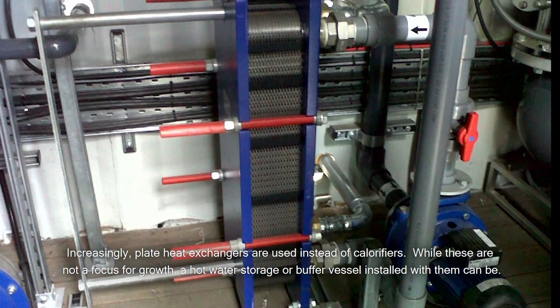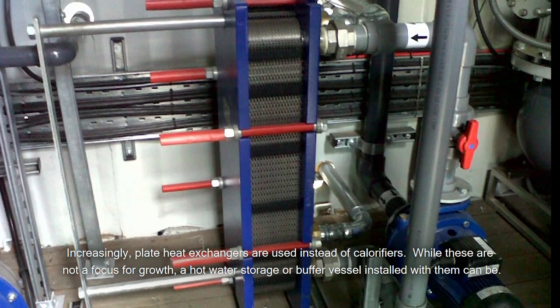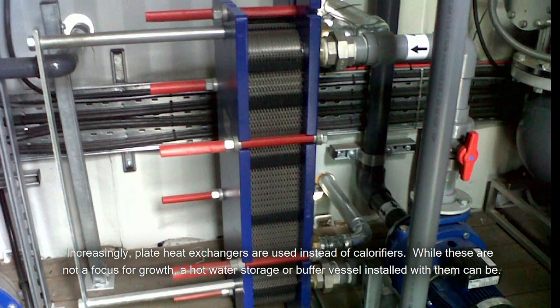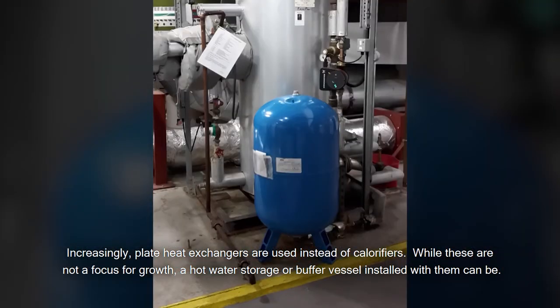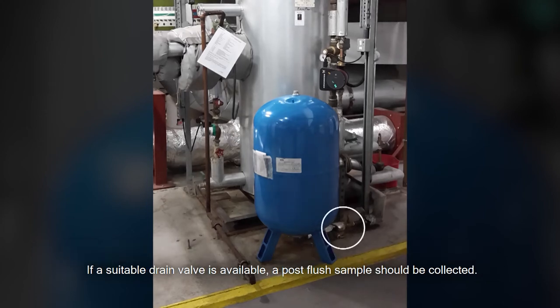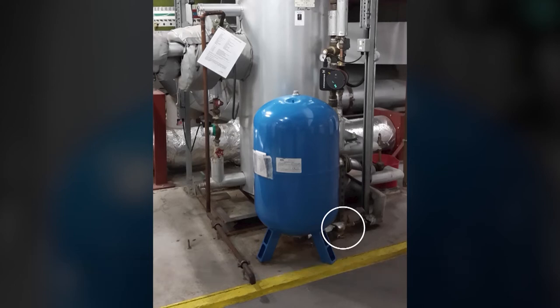Increasingly, plate heat exchangers are used instead of calorifiers. While these are not a focus for growth, a hot water storage or buffer vessel installed with them can be. If a suitable drain valve is available, a post-flush sample should be collected.